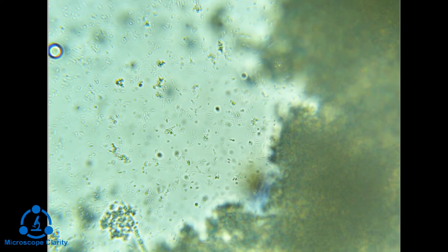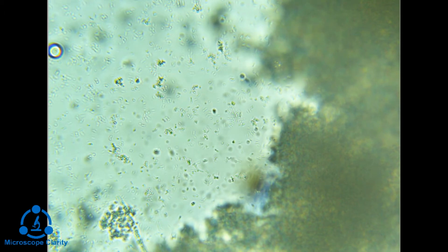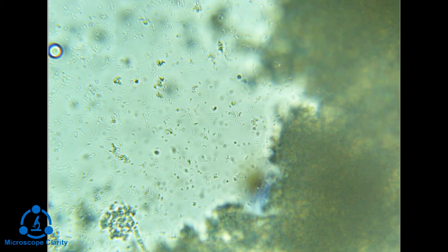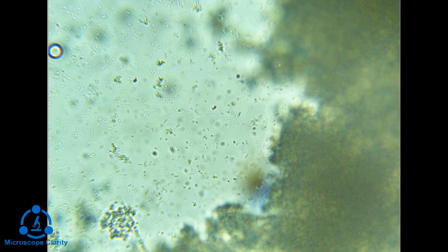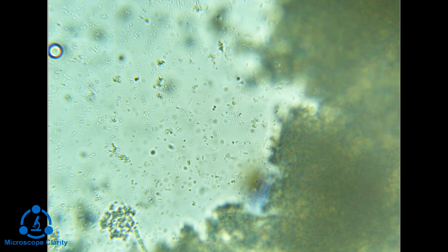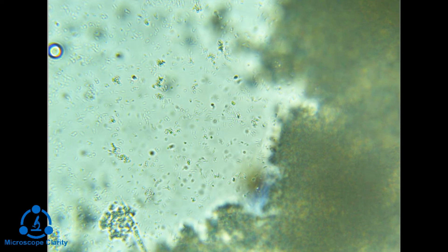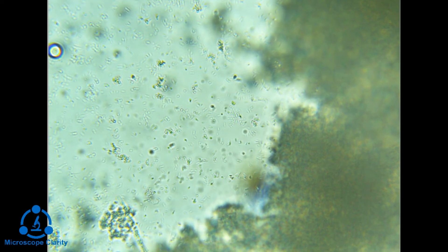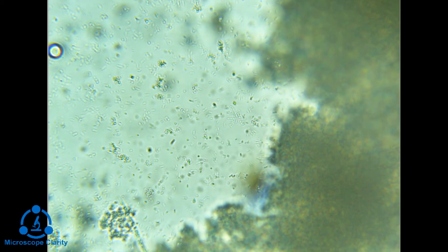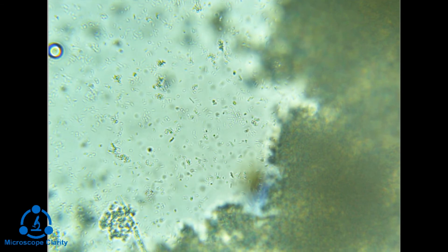So here's bacteria from the leftover smoothie that kind of started a colony growing. Bacteria are called phase objects, which basically means they're transparent — they're really tough to see under a standard bright field microscope. So what I had to do to be able to see the bacteria is actually close the iris diaphragm, which gives us a little bit of contrast, but it actually makes the resolution go down quite a bit, which is why it's not great resolution here.